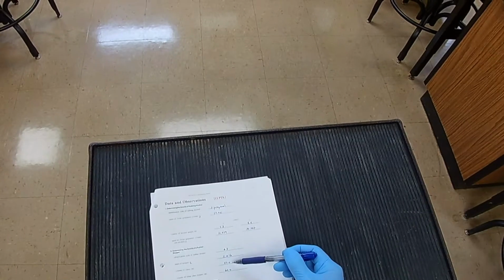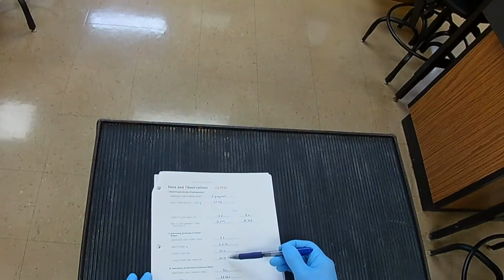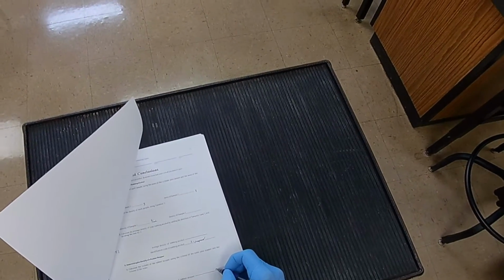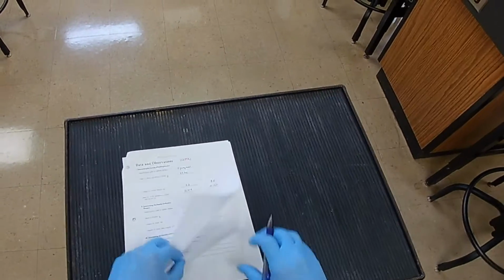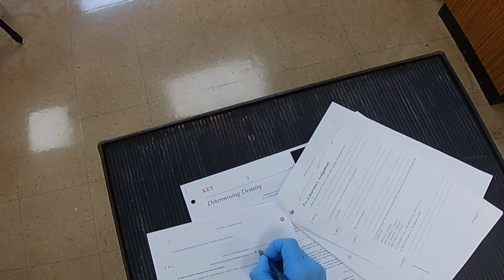Okay, you can do that. Now, what's the volume of the rubber stopper? The volume of the rubber stopper is the volume of the water subtracted from the volume after you add the stopper. All right, so we have 8.7. So you put that there, and you put the units, milliliters. All right. Now, the density of the rubber stopper is you divide that number of milliliters into the mass of the stopper. And the identification code of the stopper is a number 3.